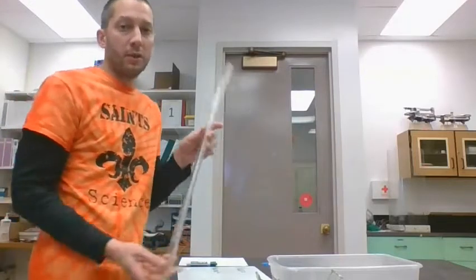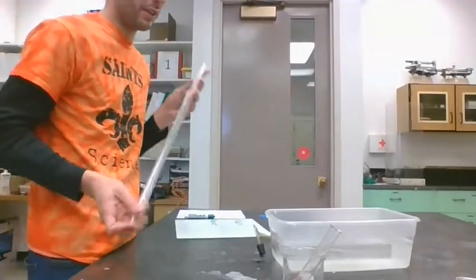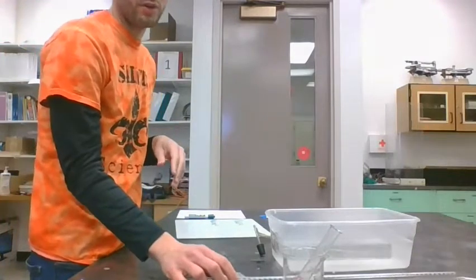Now this one's tricky because when you have a gas, think about it, we're surrounded by air. Can we really measure how much there is in there? If we just did this in an open system, it would just bubble up, travel off into the air, and we wouldn't know how much gas there is. But there is a collection method using this tube called the eudiometer, and this bucket of water, that we'll get to in a minute on how to collect the volume.